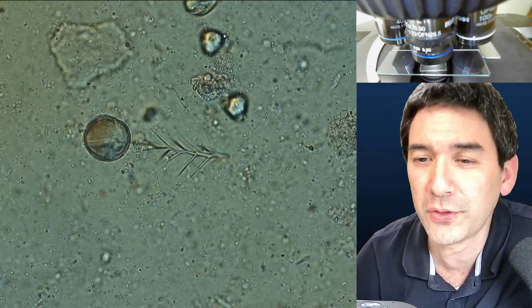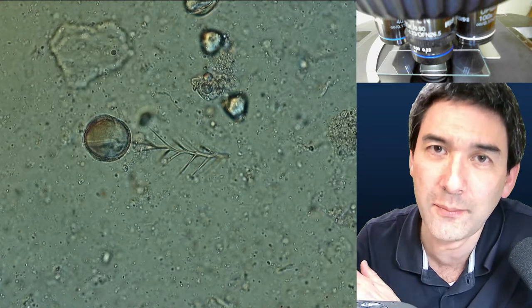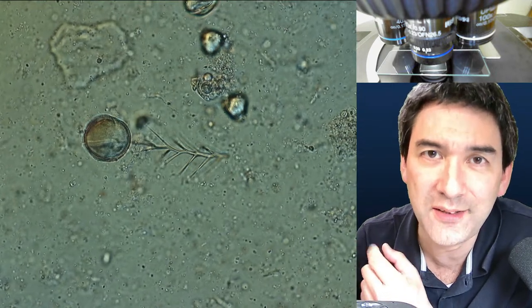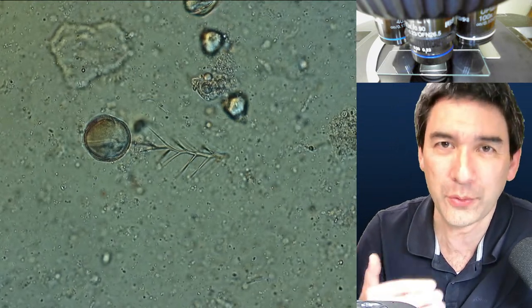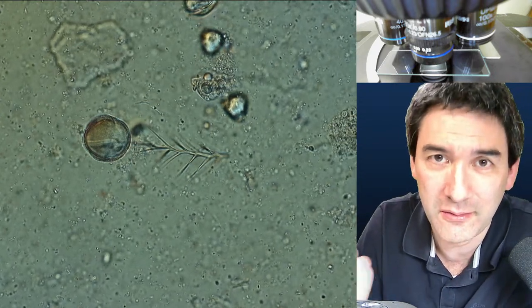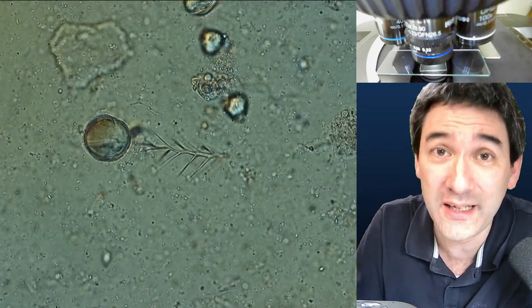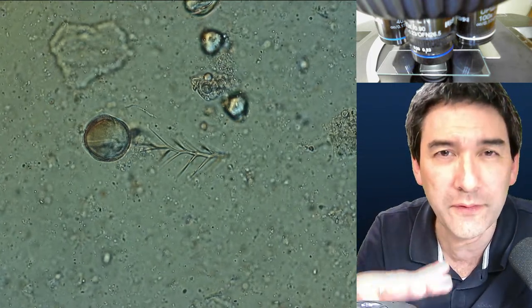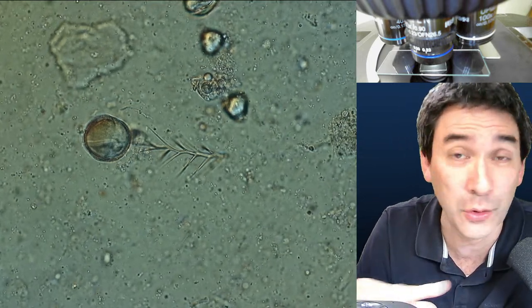Do you use a cover glass when using immersion oil? It's not a weird question at all — it depends whether you have a heat-fixed slide or not. You can use the oil immersion objective with or without cover glass. In this case where I have a liquid specimen like this, I have to put a cover glass on top and then I can put immersion oil on top of the cover glass. But this only makes sense if the specimen is very thin and the cover glass must not float at all.